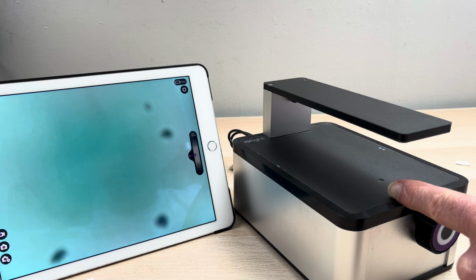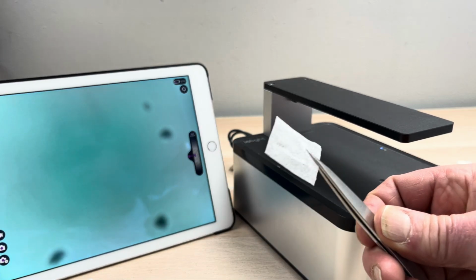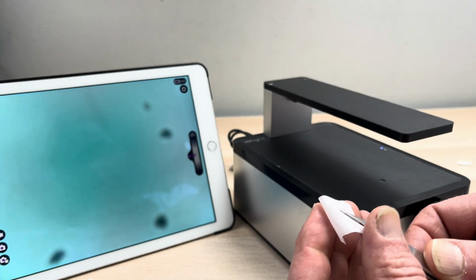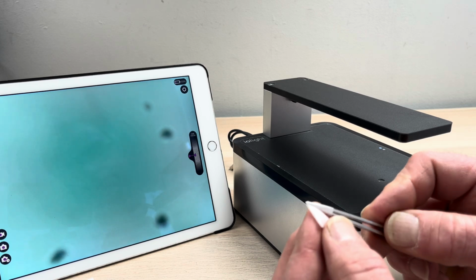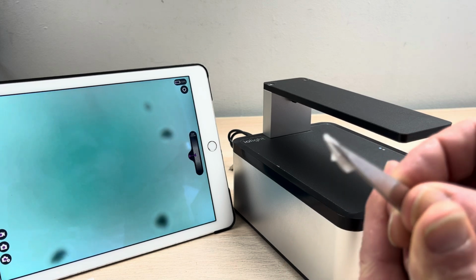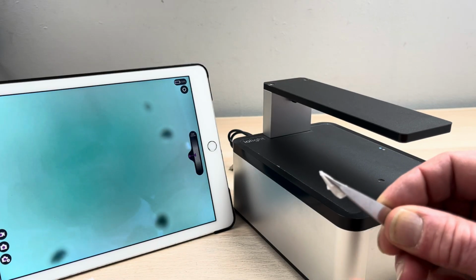the window. So what we do to clean the window is we take a pair of tweezers. Plastic are probably better, but I'm using metal here today. Cut a small piece of lens tissue, the kind of lens tissue you get in a camera shop for cleaning normal camera lenses. I then fold that up, wrap it round the tweezers to form a little point. I'm trying to keep my fingers off the end. I've pulled the tweezers out and I'm now going to grab hold of it so that I've got a little piece of tissue sticking out just beyond the end of the tweezers, a little pointed piece of tissue.